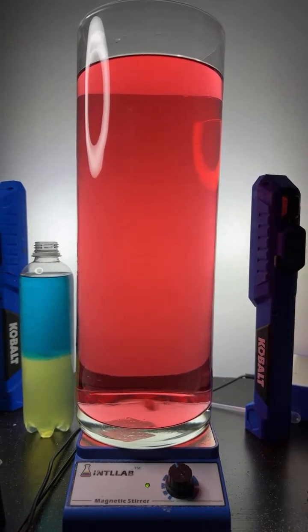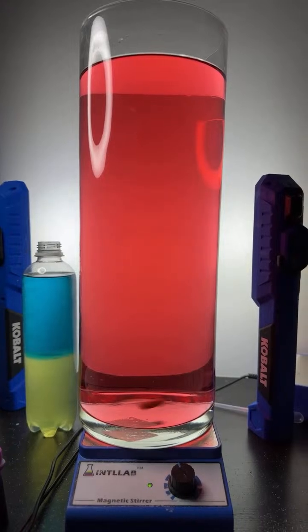So I do my content on YouTube, I do science stuff. So I do science experiments with a little bit of fun involved. Then goes a couple drops of base.